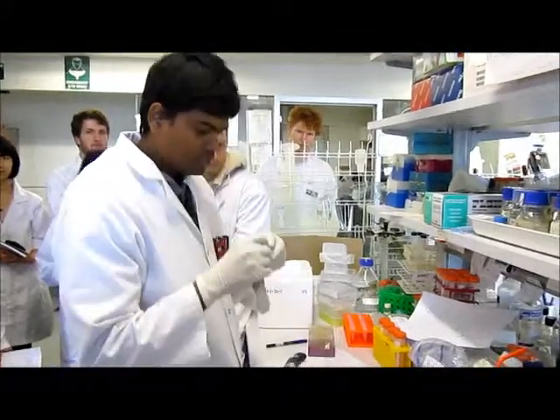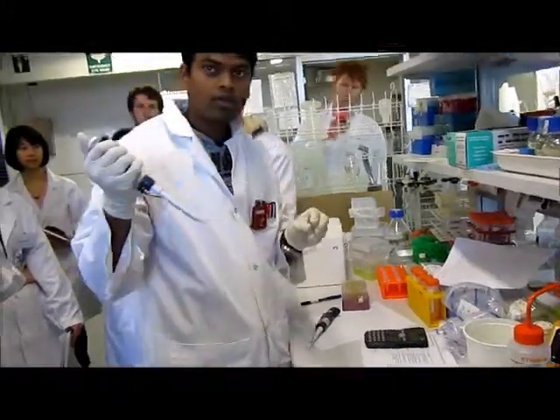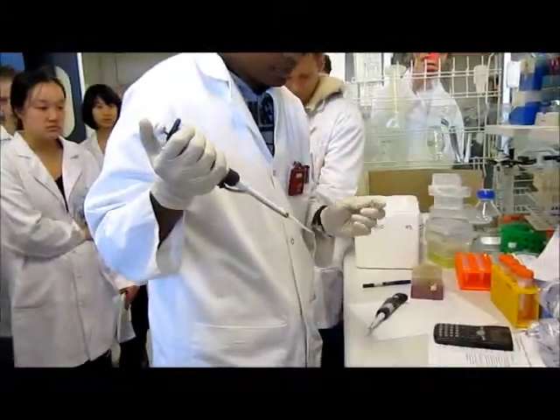So this is our MAC 1 plasmid. PMK MAC 1.